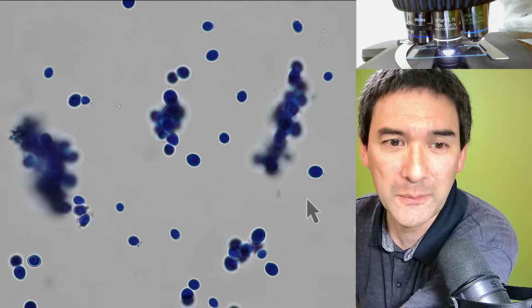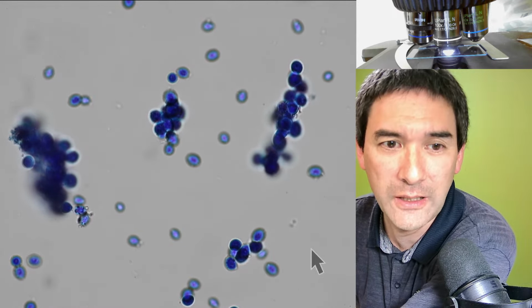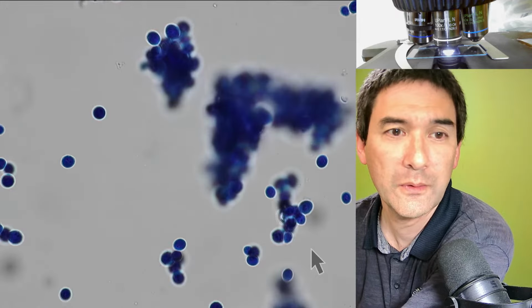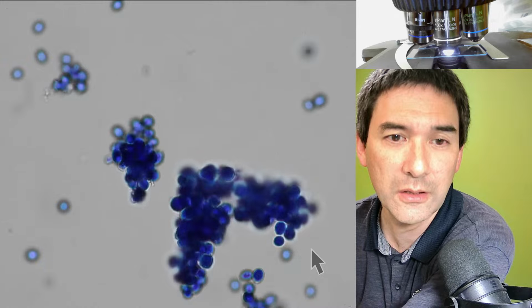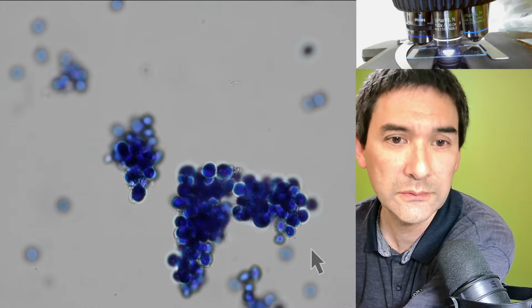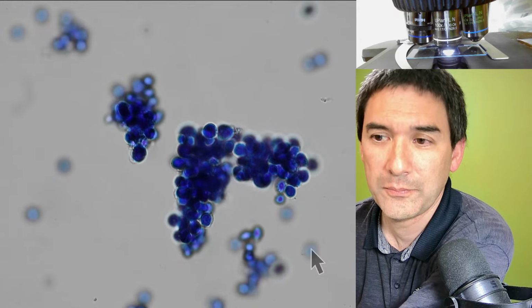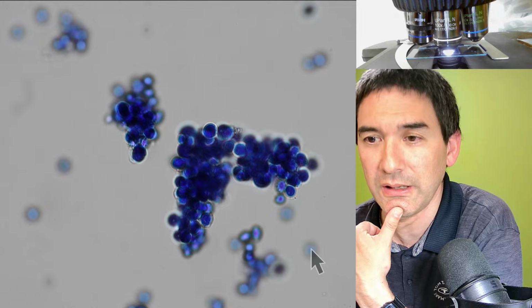But it actually also works. Maybe this illustrates a little bit this comparison of why you actually do heat fixing as well. Or over here, for example, those cells here. You see that they're still clustered together, and because they're surrounded by liquid, by water, that means that they're still able to move a little bit. So this is simply something I just wanted to demonstrate to you.